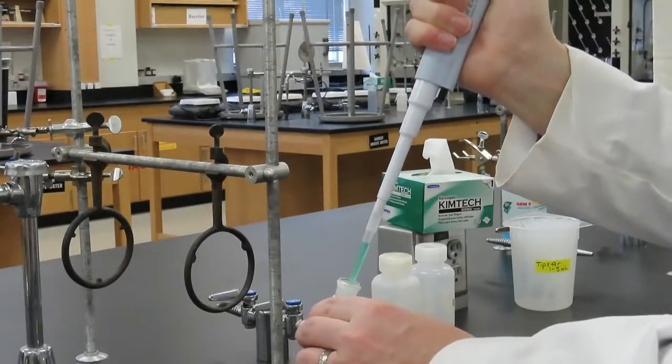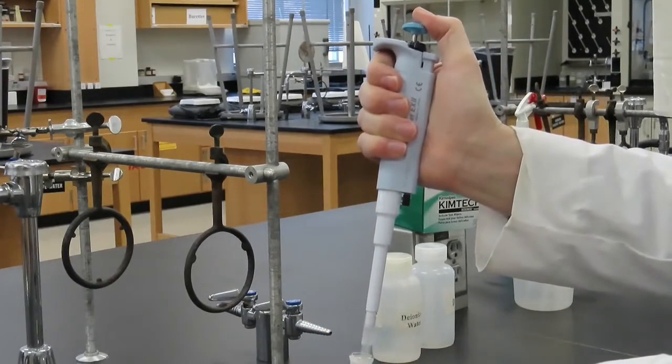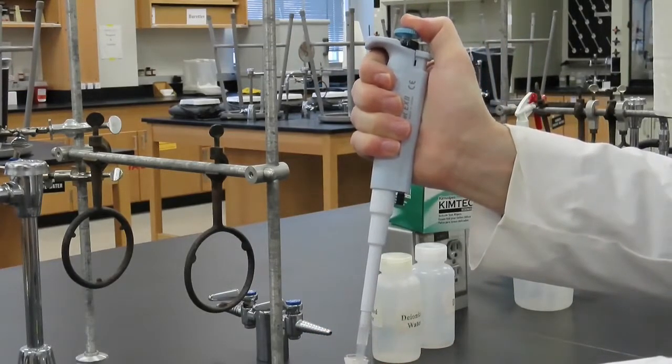Finally, to deliver the known volume of liquid, push the plunger to the first stop, pause a moment, then to the second stop.